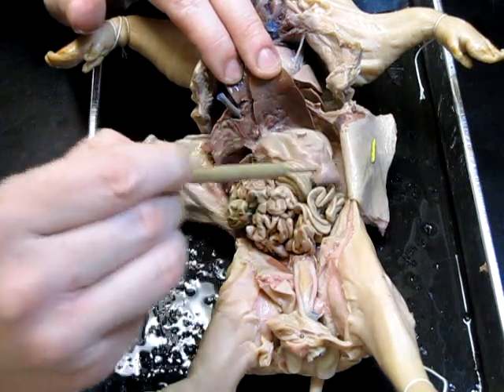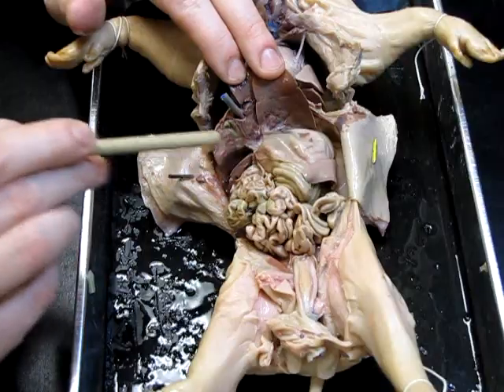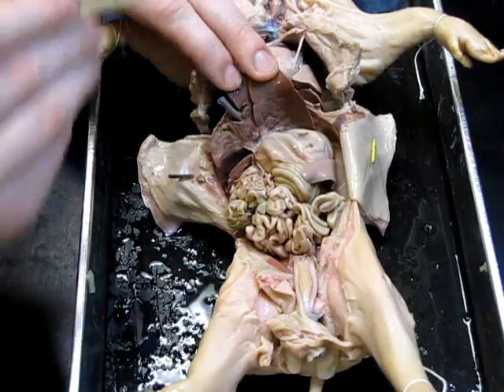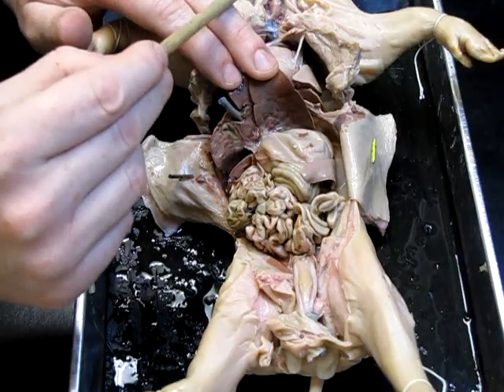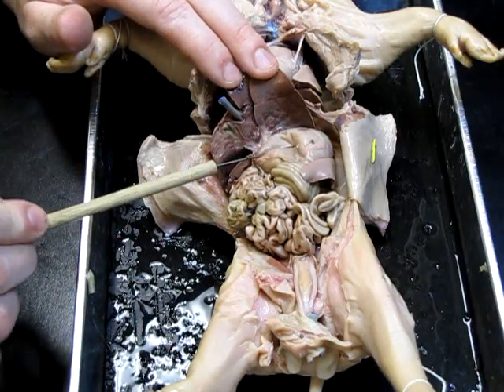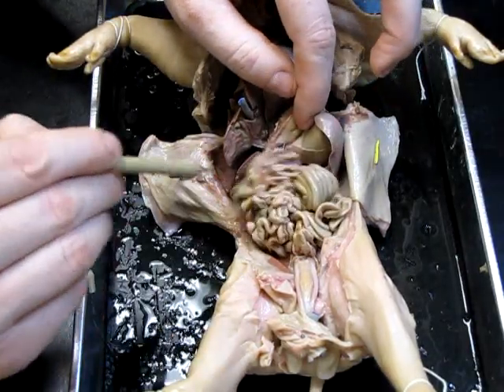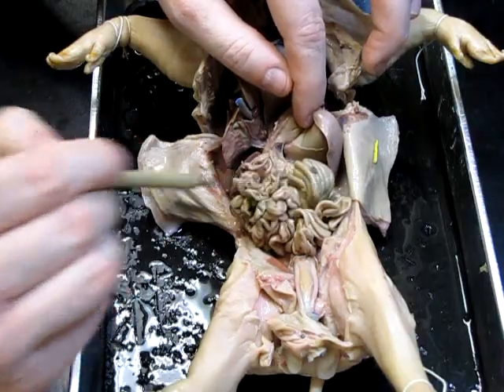Now this big bag right here below the liver, this is the stomach — this is where food enters from the pharynx through the esophagus and then into the stomach. From the stomach we can find, of course, the small intestines. That's all these many, many coils here.